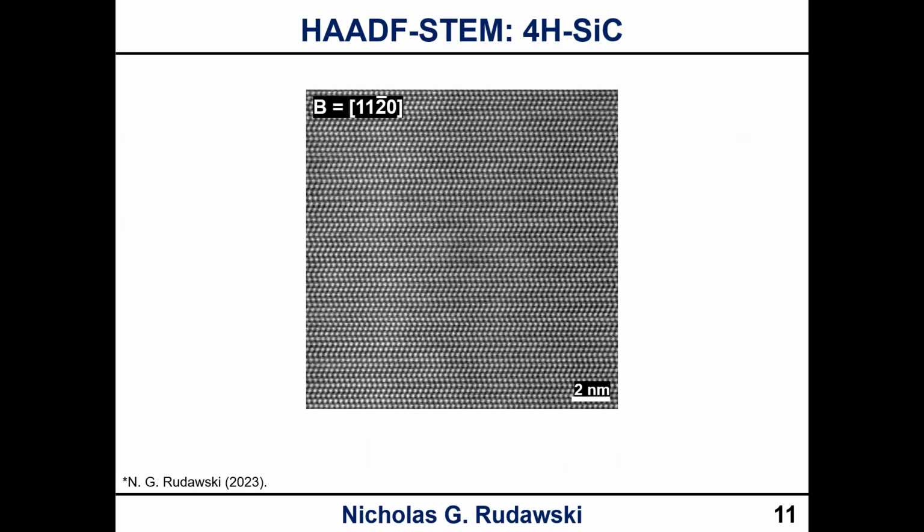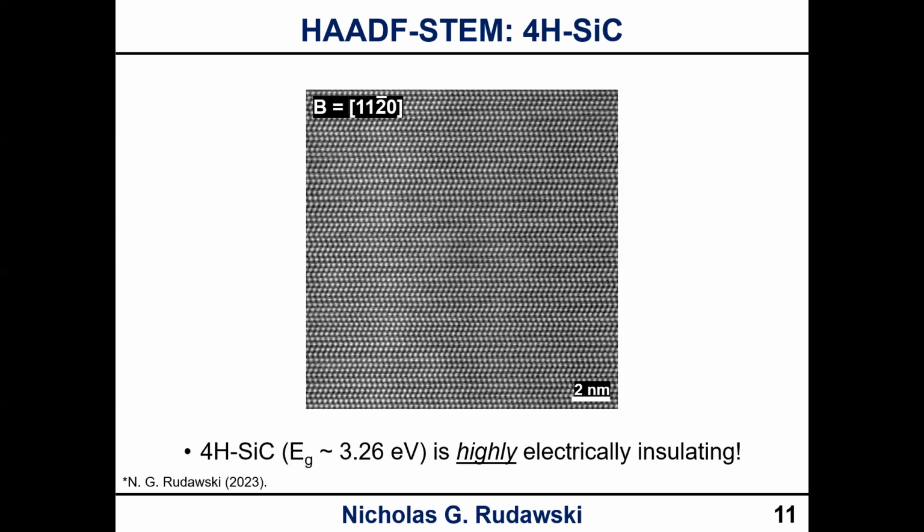So here is HAADF-STEM of 4H silicon carbide along 112 bar 0. This was not taken with CS correction, so this was taken on the Talos. This was an uncorrected image, and still a very nice one as far as coming from an uncorrected microscope, because we're resolving those silicon columns very readily here, of course, right? And silicon carbide, again, is a very insulating material with a very high band gap of around 3.26 electron volts, okay? So even here, no problems.